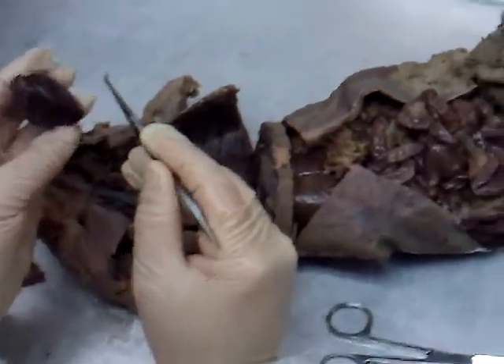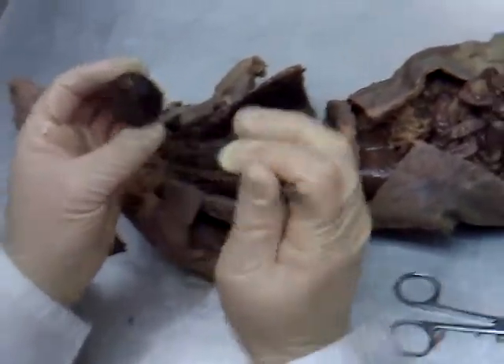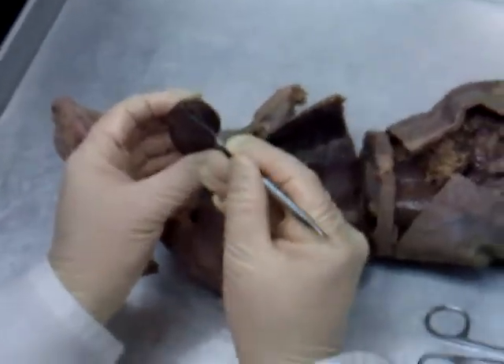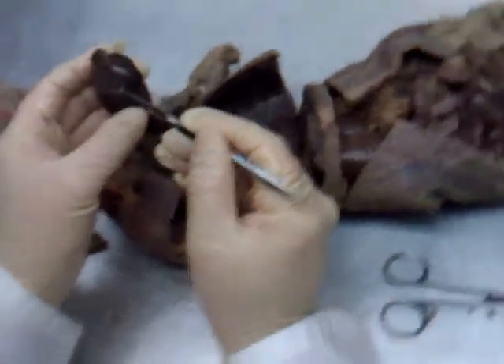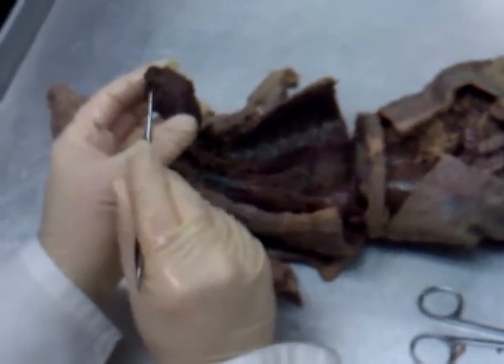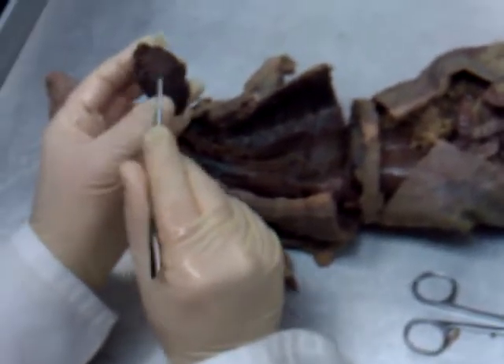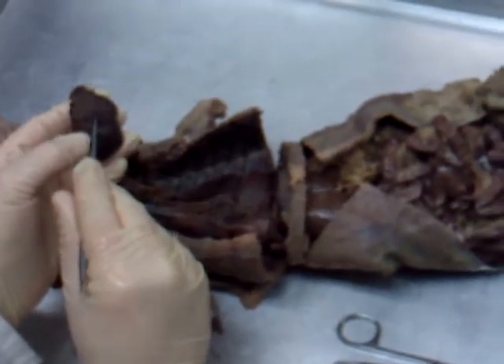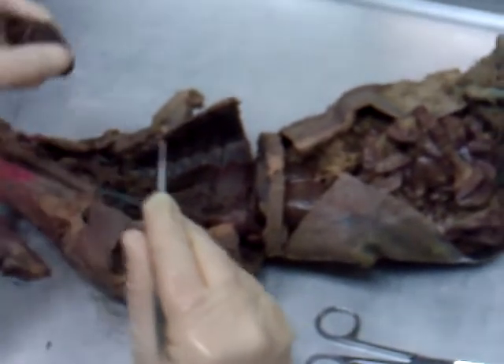As far as the vessels go, it's a little trickier to see on this mink. You can kind of see the stoplight — one, two, and three. So on top here: this would be superior vena cava, aorta, pulmonary trunk, and down here is inferior vena cava. Right there would be one of the pulmonary veins. So that's the heart.